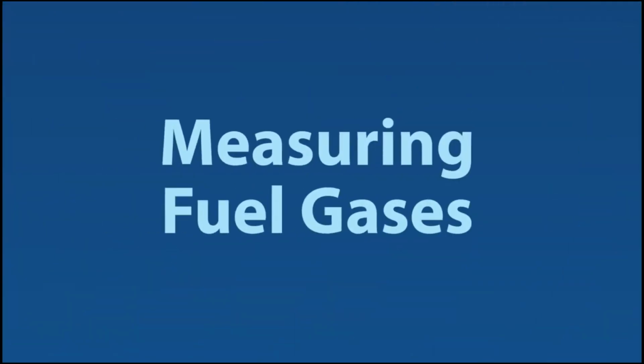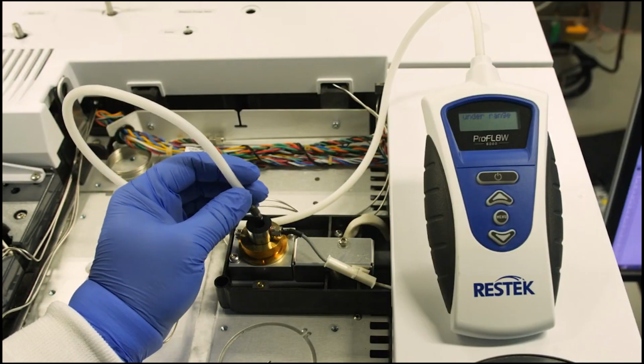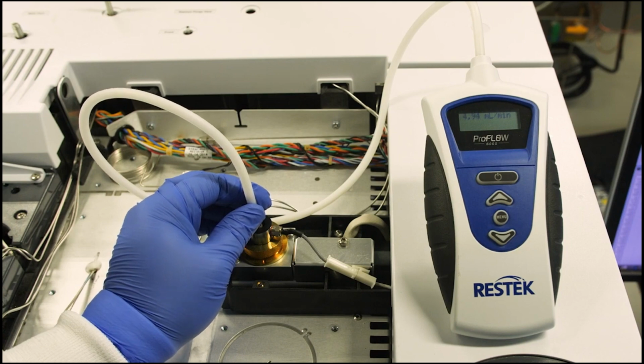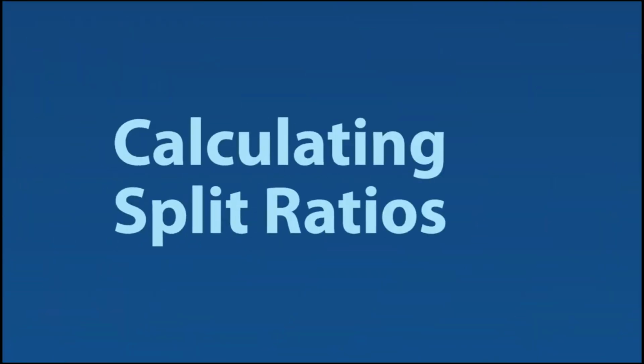Measuring fuel gases. Detectors like FIDs rely on specific gas ratios, in this case, air and hydrogen. These ratios have a limited range in which they can fluctuate in order to maintain proper function of the detector, and a flow meter can help you monitor and stay within the ratio.